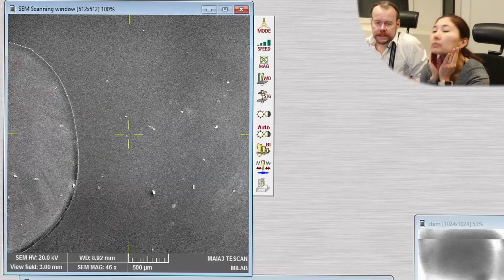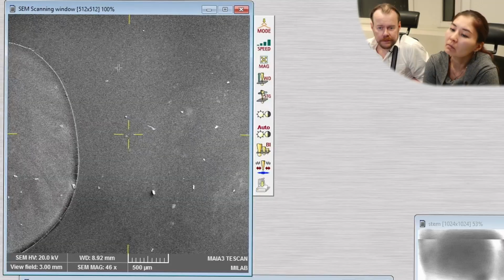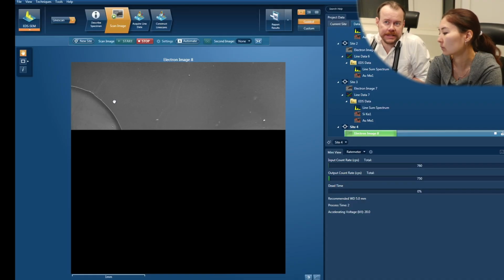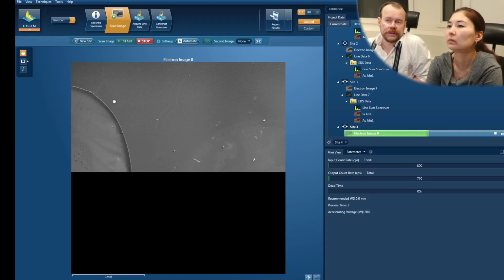So let's say sometimes you want to do a line scan over a large distance like this, several millimeters. It can be like in metallurgical things, a weld or something like that you want to scan. And if you just do that straight on here. Now, this is very nice because we know this is a silicon wafer. It's all silicon. It's super flat also. So it's ideal from an EDS perspective. Here we can see the dry drop in the corner.